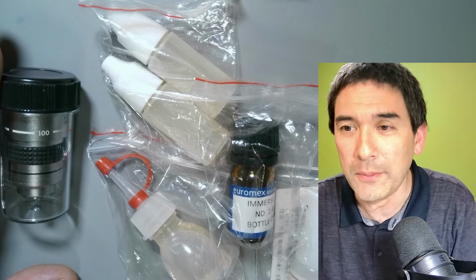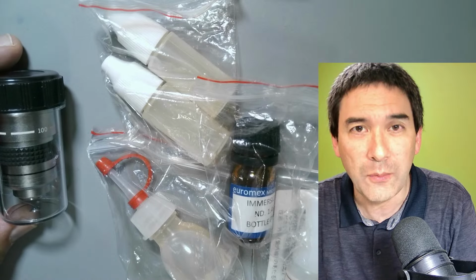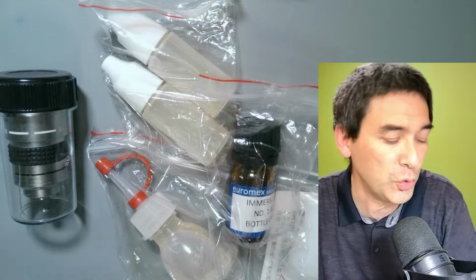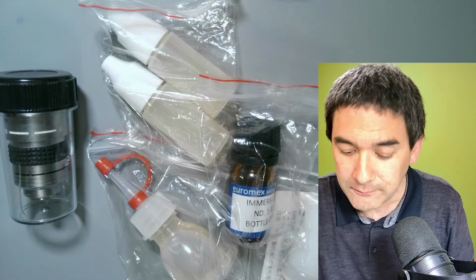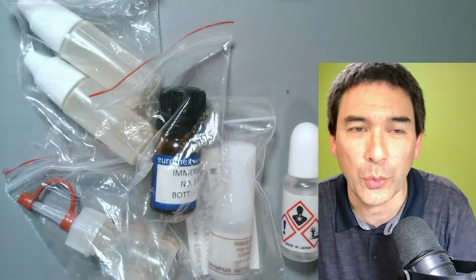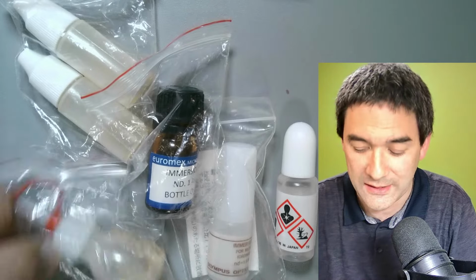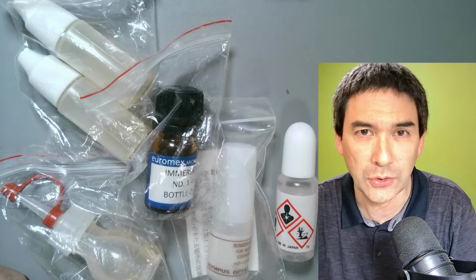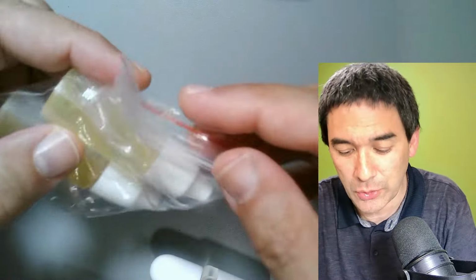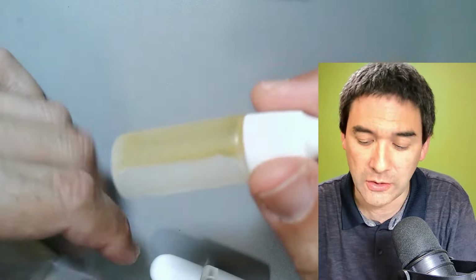So I'm going to jump directly into the program, what I wanted to show you. I usually use the first couple of minutes to talk a little bit about the theory, and then I'll show you some practical stuff as well. What I've got here is, look at this here. Immersion oil, of different types and brands, and not all of them work. Why not? Because look at those immersion oils, and this is already the first point that I want to make before I actually tell you what it's good for.